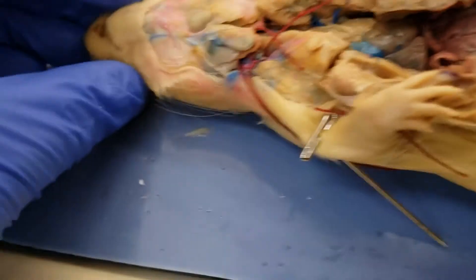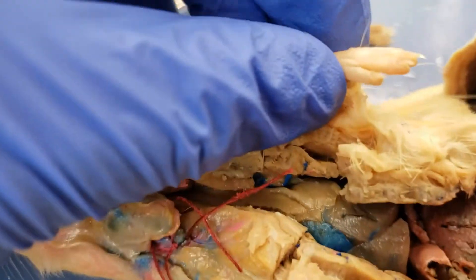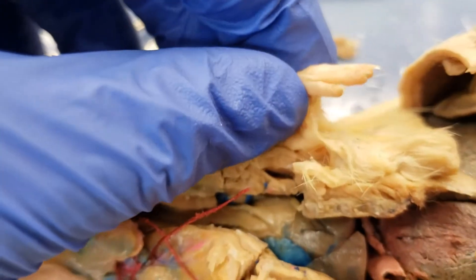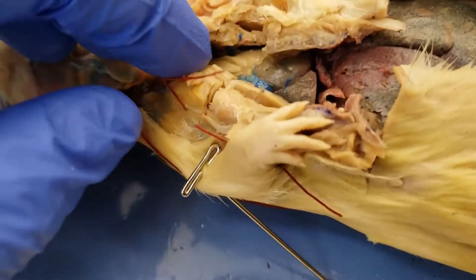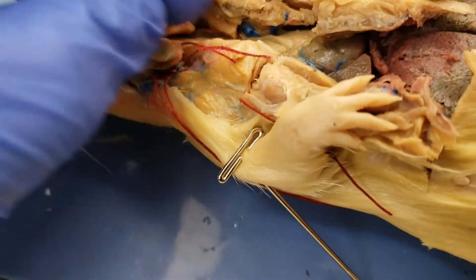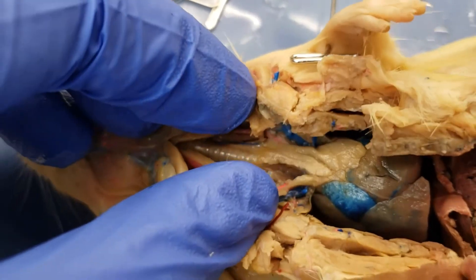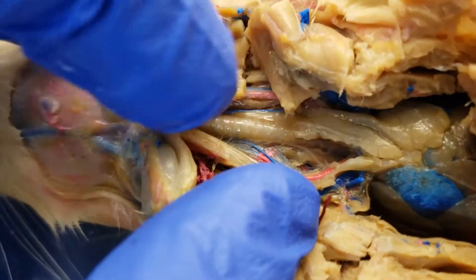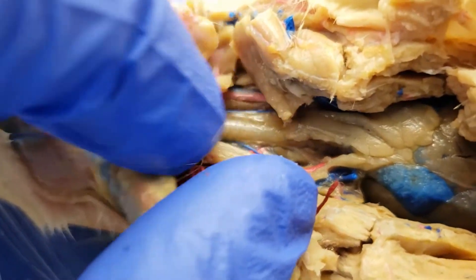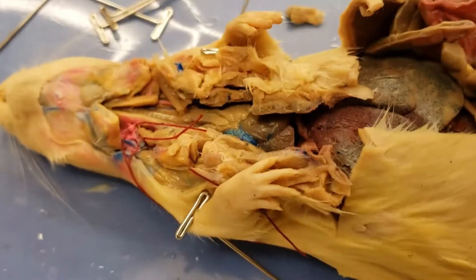Let's go back up towards the head. There's a little head. This thing's got some claws on it — look at those things. I've run across those claws a little bit performing this dissection; it has not been the easiest avoiding them. But this tube you see right down the middle, this little ridgy tube, that is one of our first structures we'll look at.